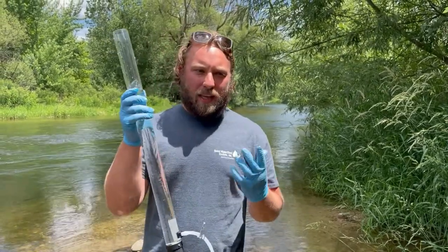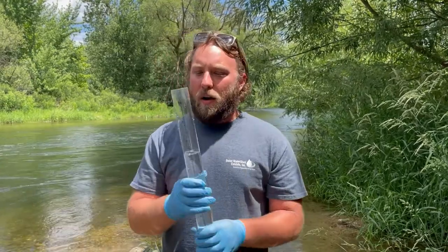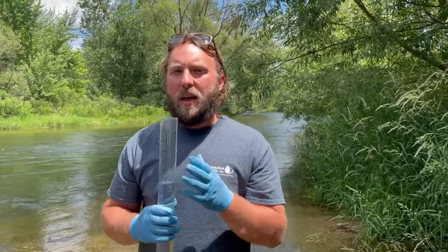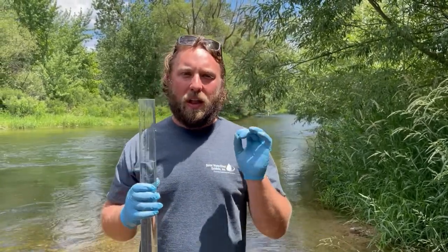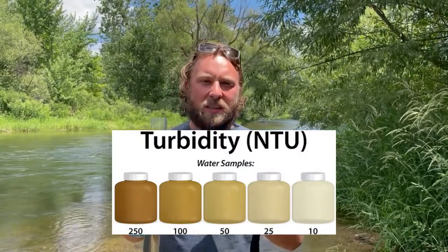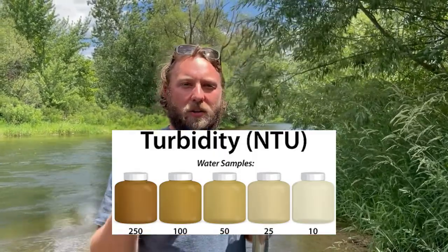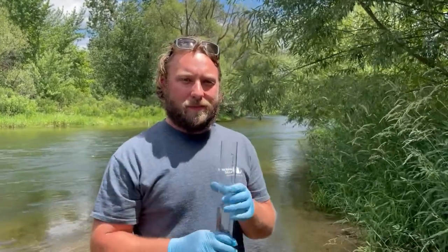So that is how we take a turbidity reading. After we record it, we'll be able to transfer these centimeters into units we call NTU, or nephelometric turbidity units. And these units help us understand how clear or how dirty the water is.